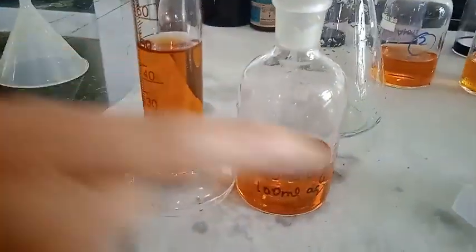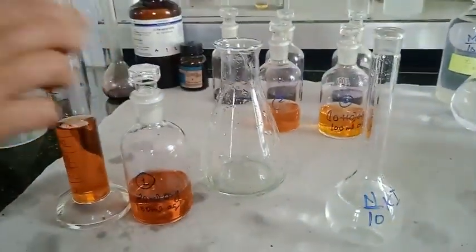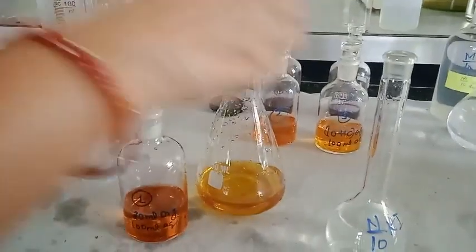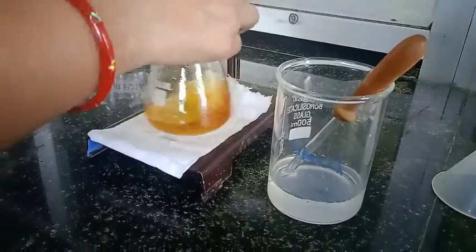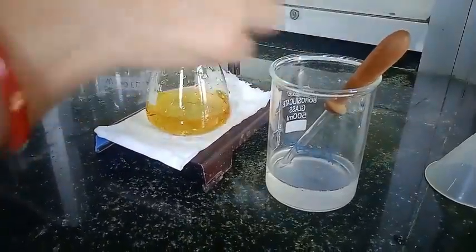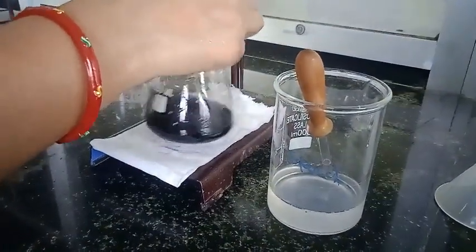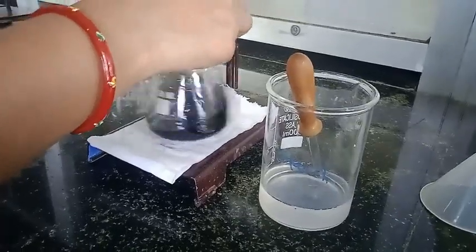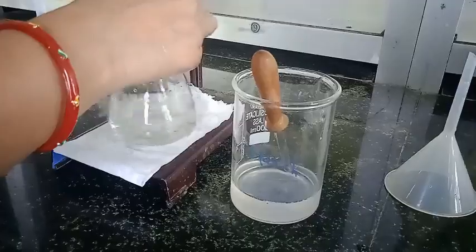So again I am going to add 10 ml of potassium iodide and 50 ml of aqueous layer from set 1. I close it and now I am going to titrate it with M/100 sodium thiosulfate. Once the color is a little faint, we are going to add starch. In this set I have added 2-3 drops extra, which again causes an error, so try to avoid such kinds of errors. Now the reading.